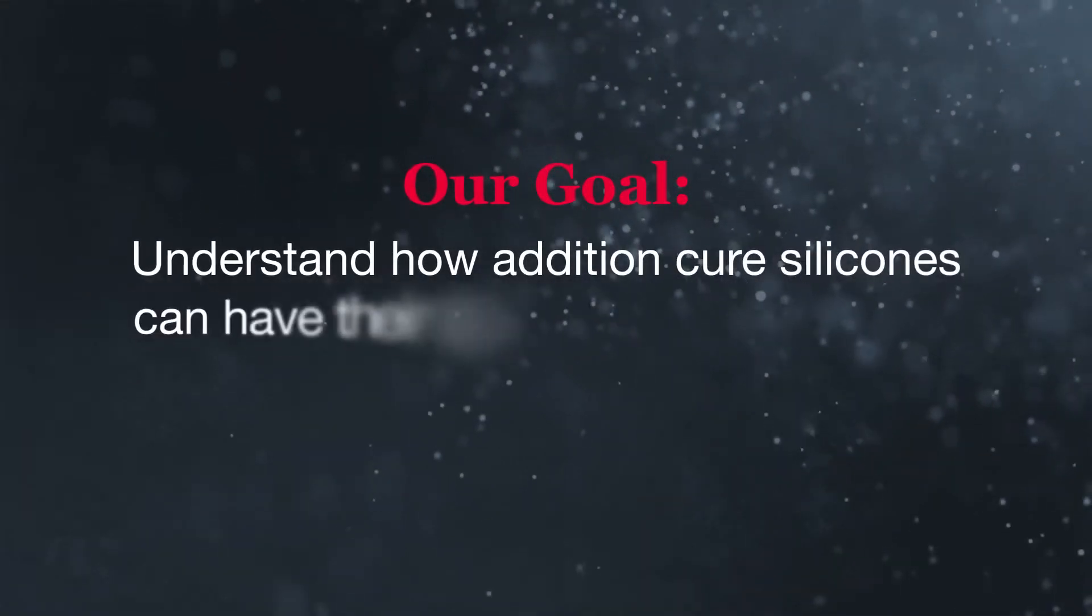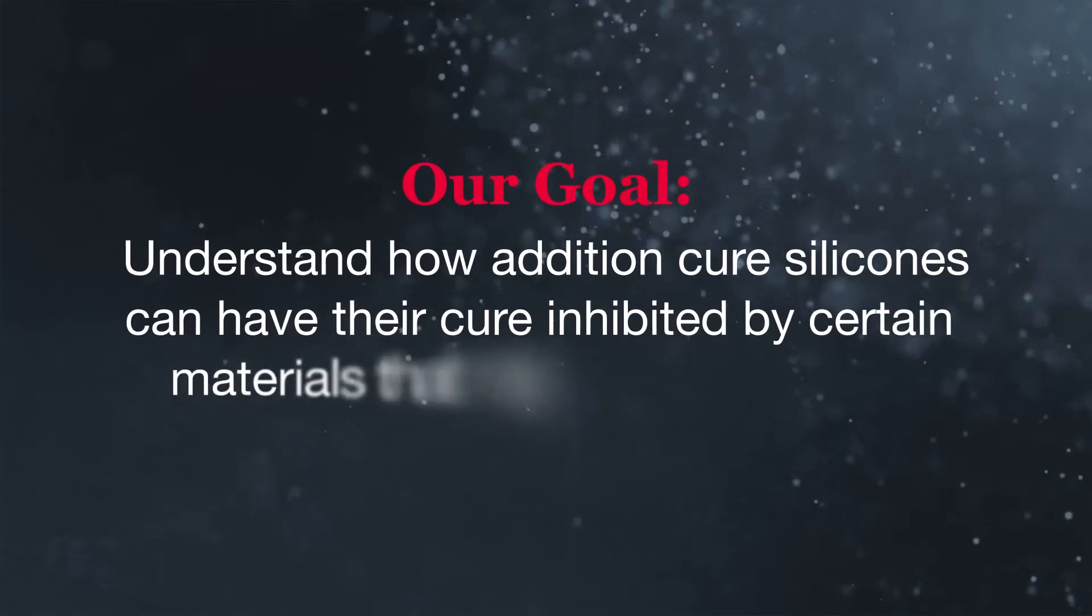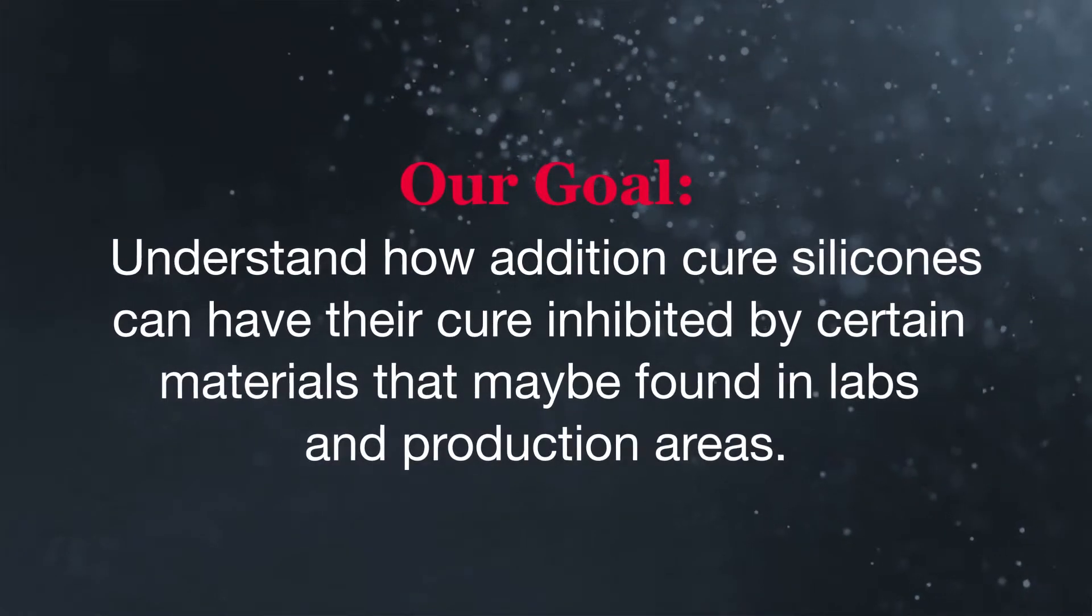In this video, our goal is to understand how Addition Cure silicones can have their cure inhibited by certain materials that may be found in labs and production areas.